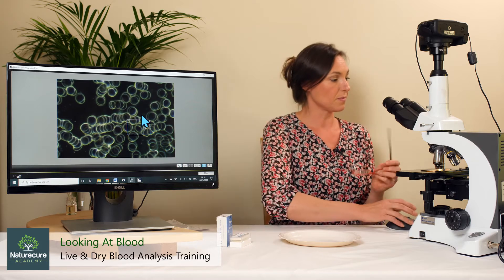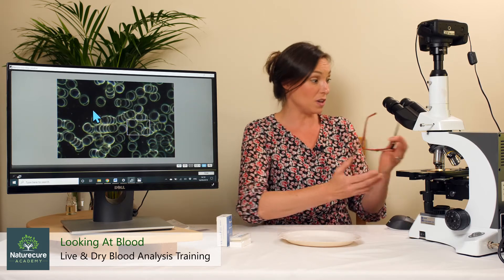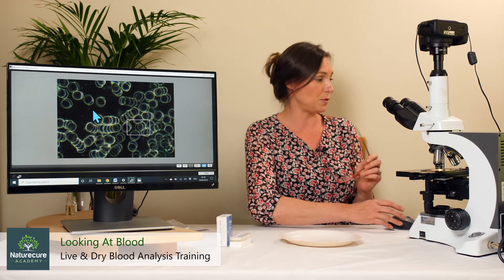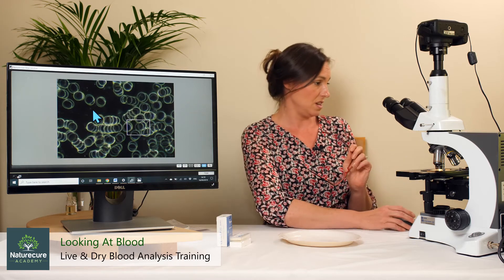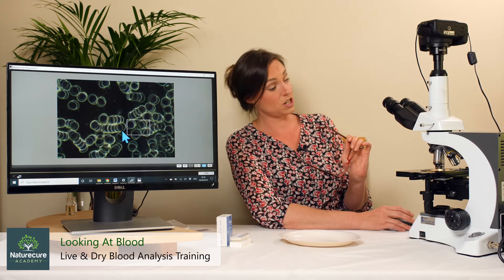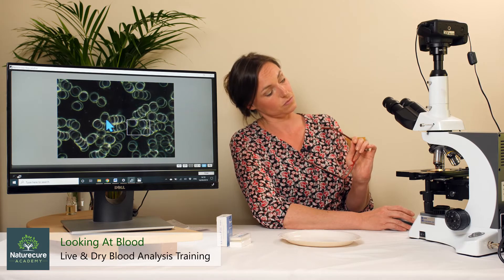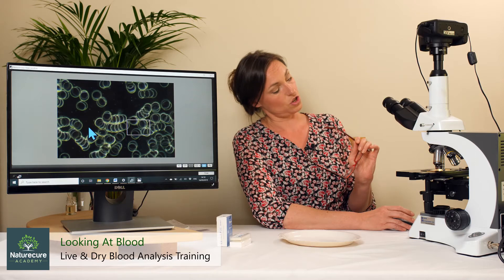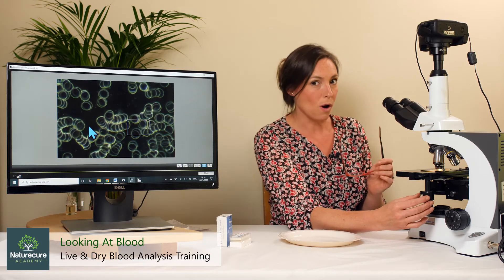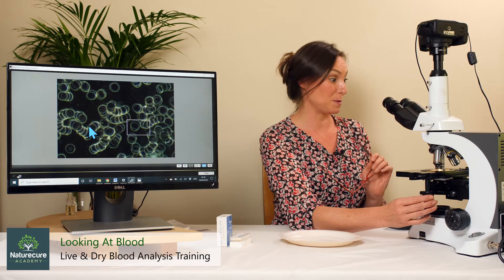If the plasma is free of obstacles and allowing them to float, we can see here that a lot of these red blood cells are actually connected together. We'll learn more about why that may be when we go into more detail about the blood.